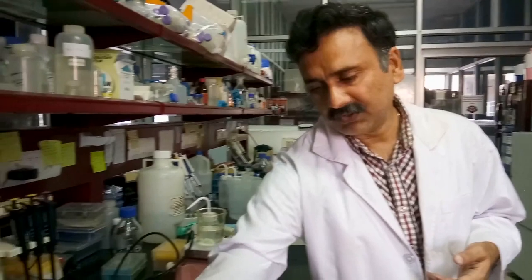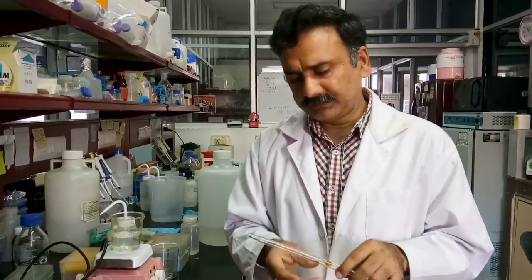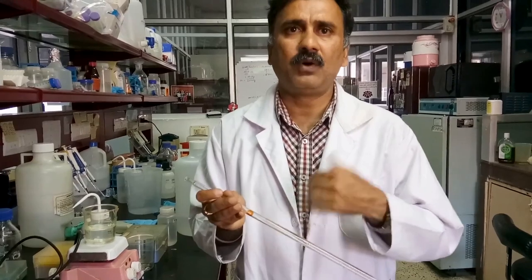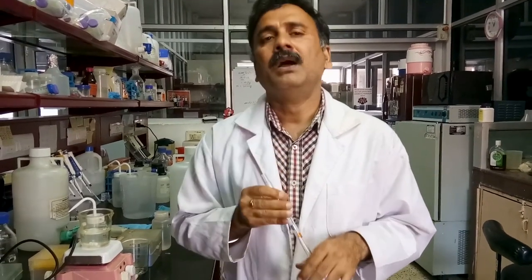If you want to dispense large quantities of liquid to feed cells — such as liquid media of 5 ml, 10 ml, 20 ml, or 25 ml — you can use glass pipettes. This is a typical 10 ml glass pipette. You cannot do mouth sucking with these pipettes because corrosive or other liquids can directly enter your mouth, so it is not advisable. Instead, you use a pipetter, which does the same job more safely and reliably.